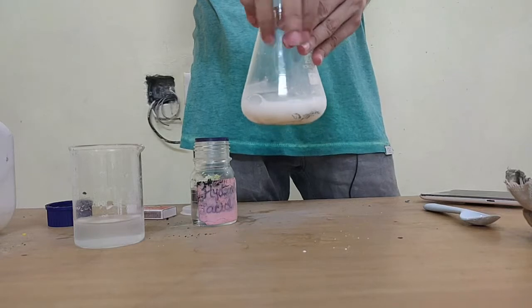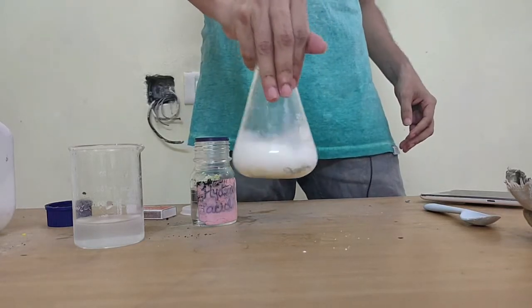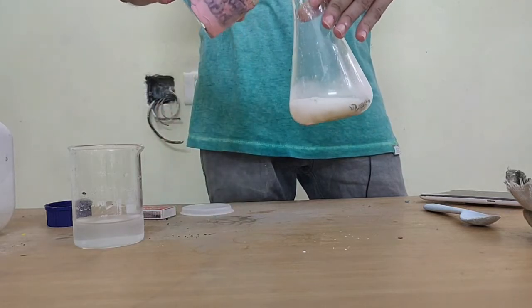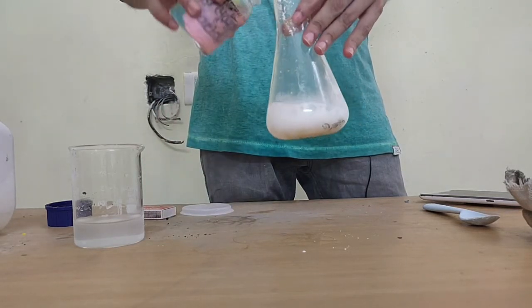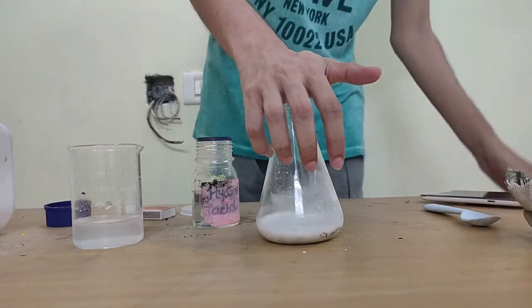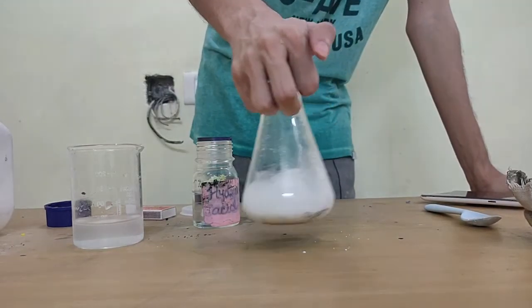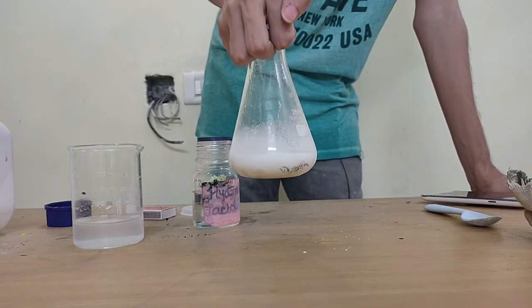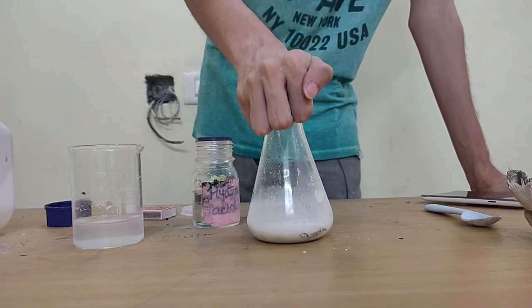So you see it has become like a pasty little liquid and most of the reaction is done. Let me just check once more. There, still reacting, right? I want to try to contain the gas here, which I'm not sure if I'll be able to do, but there is a gas being produced, that is quite evident, right?